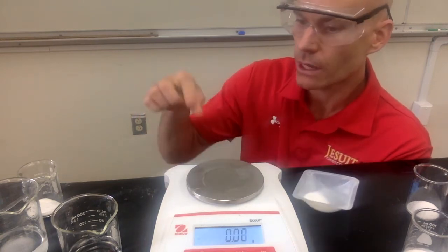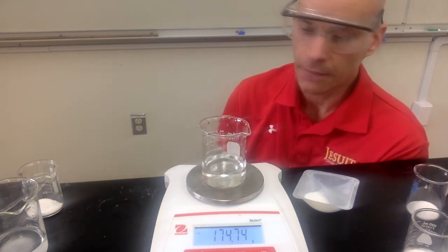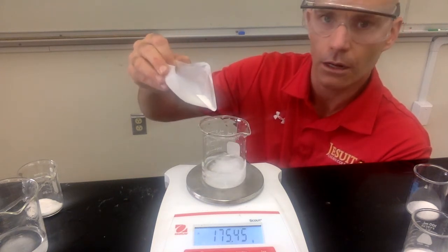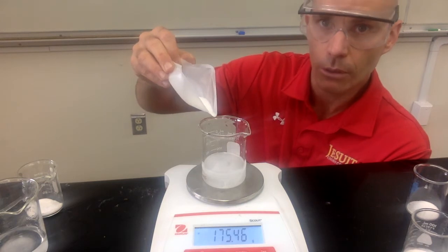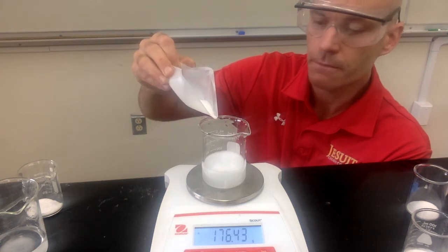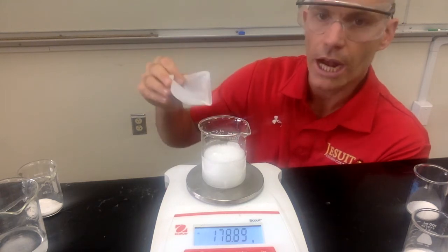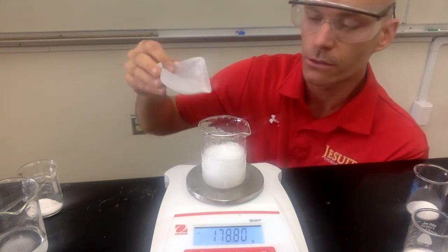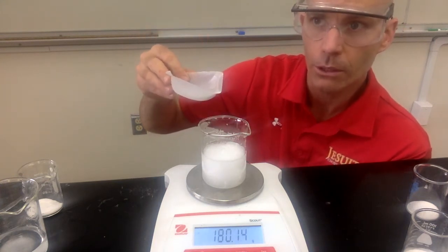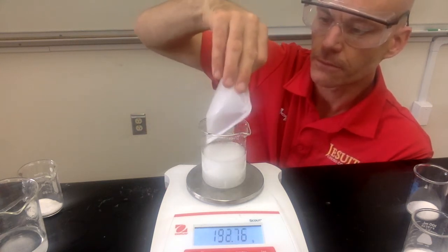So there's my mixture. We got the mass of it. And here's a new beaker with acetic acid in it. And so this time when I add it, it's going to produce some carbon dioxide. Not as much as the pure sodium bicarbonate, but more than when we just did the sodium chloride. And so what we're going to do here for the calculations is, once we're done, subtract and figure out how much carbon dioxide is produced. And then we'll compare that to how much carbon dioxide would have been produced if it was just pure sodium bicarbonate, and use that to find the percentages in the mixture.